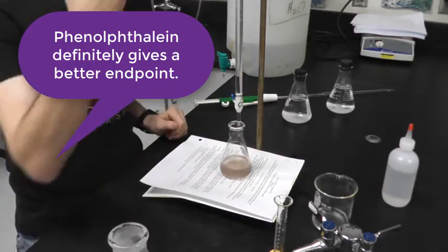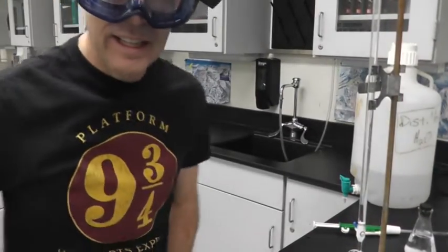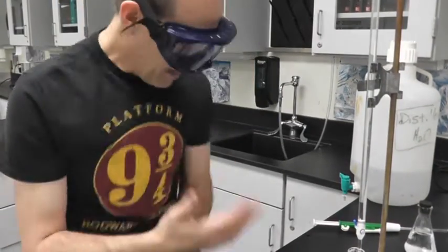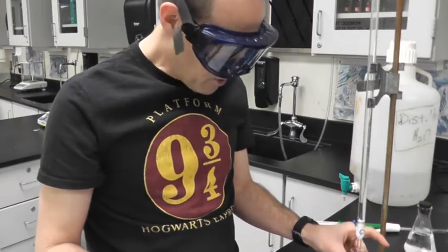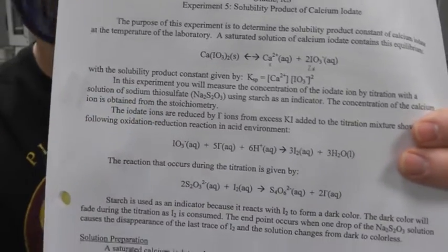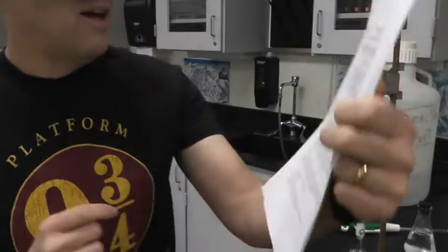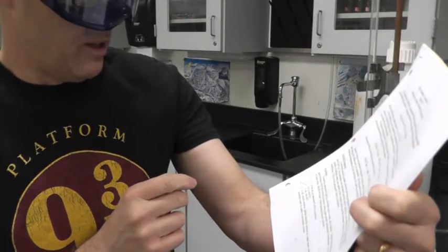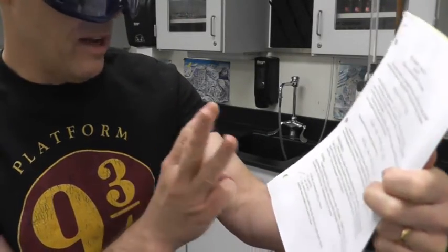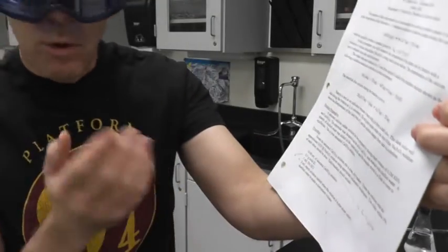Yeah. So I'm going to record my new volume, and that is the amount of sodium thiosulfate that I needed to titrate my calcium iodate. So notice, I've got two different equations happening at once. So the concentration of sodium thiosulfate, Na2S2O3, okay? So this guy right down here is 0.25 molar.